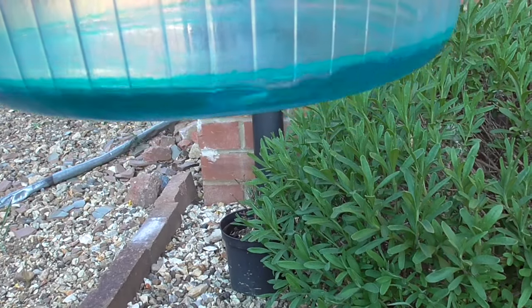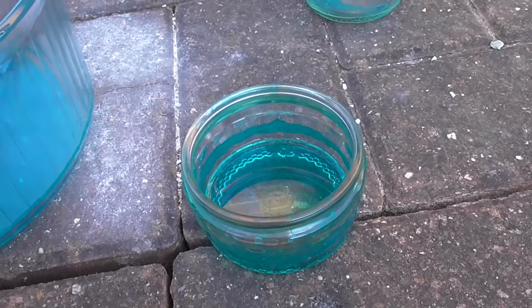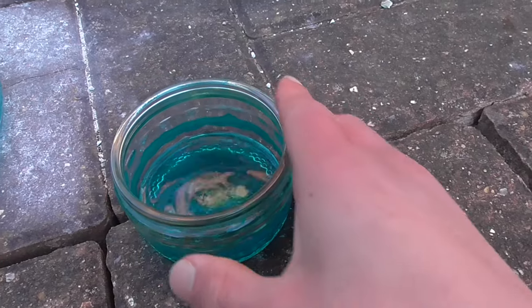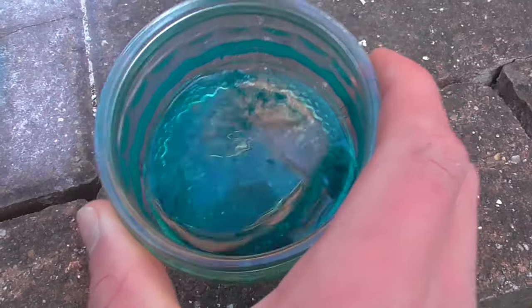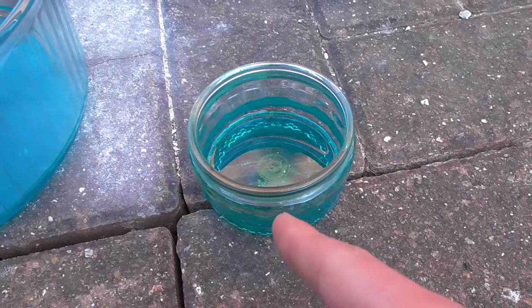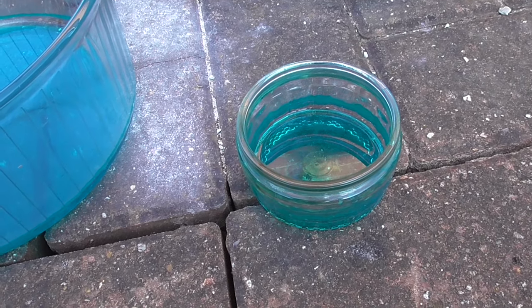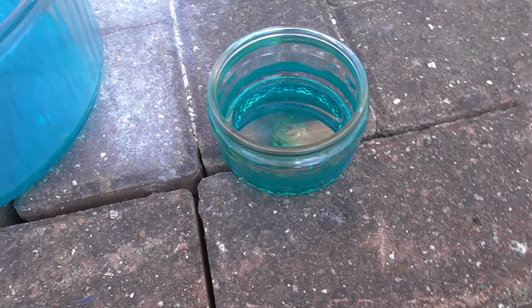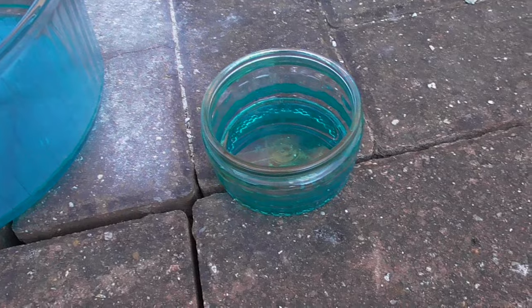I don't know if you can see those — probably not. But there is stuff crystallizing on the sides. My previous batch is a more concentrated solution, so there are more crystals that have crystallized. You can see there. So what I'm going to do is remove these crystals, because these crystals are going to be the purest. Then collect those crystals, let it evaporate some more, and collect more crystals — and keep doing that.